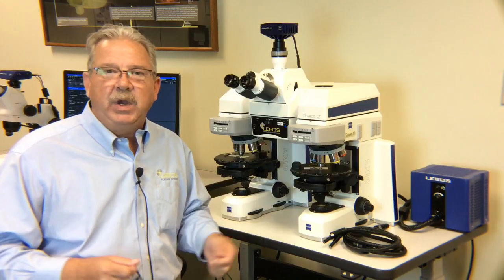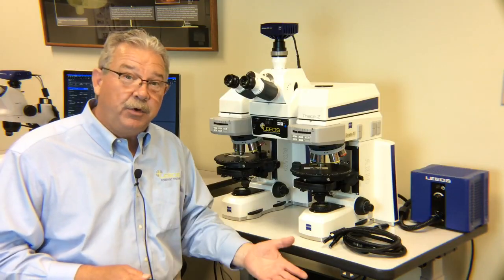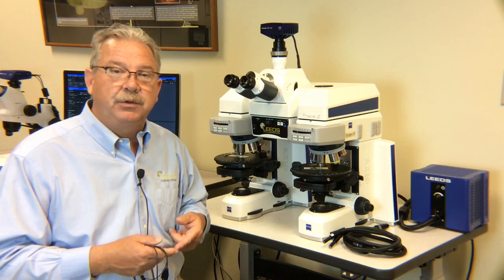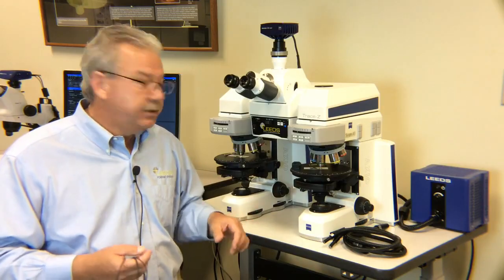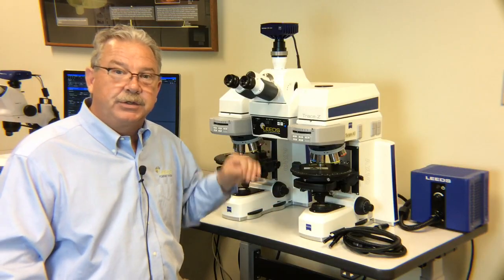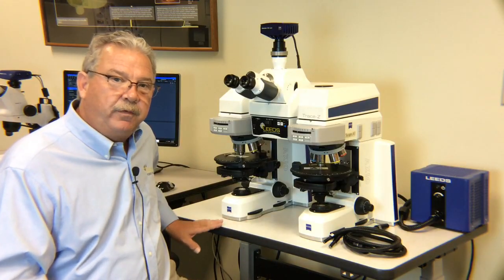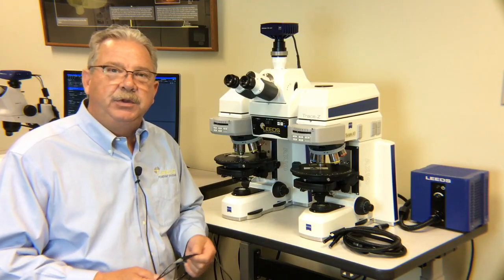If you've got two red carpet fibers that you believe are from both the victim and the potential crime scene, when we place them side by side in the comparison microscope image, we're expecting them both to show the same red color if they are truly identical or from the same source. The problem is that, believe it or not, all kinds of components in the microscope have slight optical shading to them. And you would never notice that if you had two freestanding microscopes and you moved from one binocular over to the next binocular and looked at the same sample, you would think they looked the same.